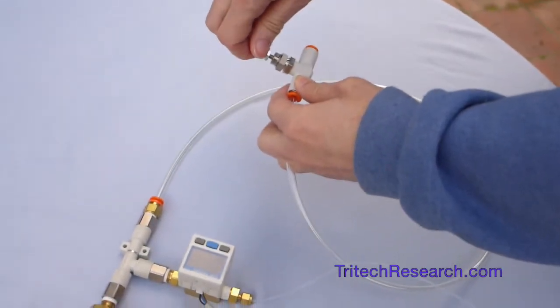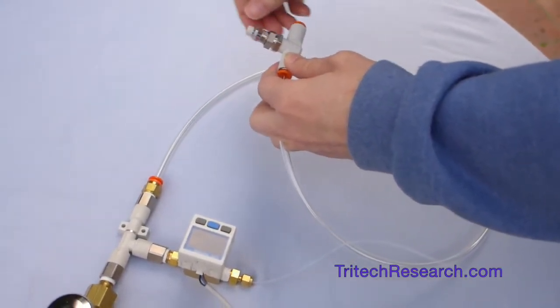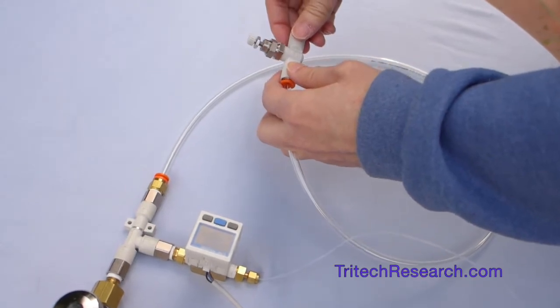And anywhere in between is in between, so you can actually get it to where it's balanced and there's no pressure at all.